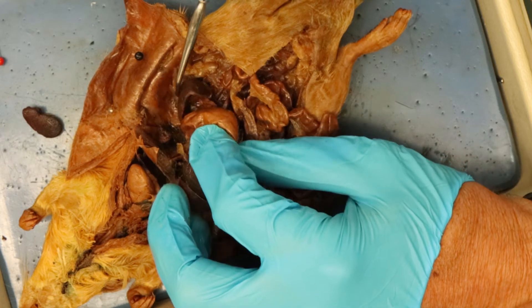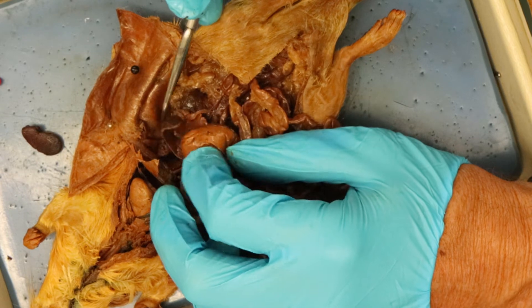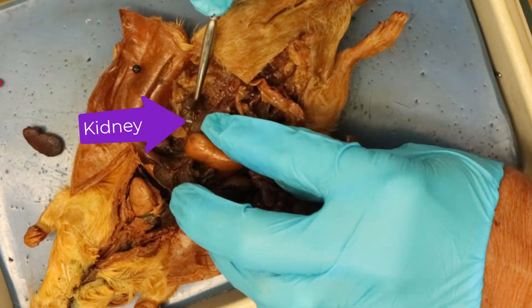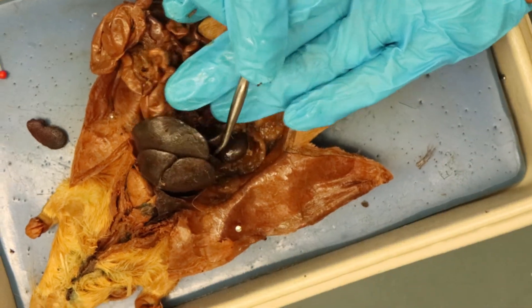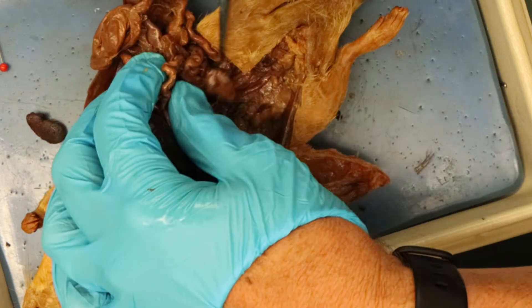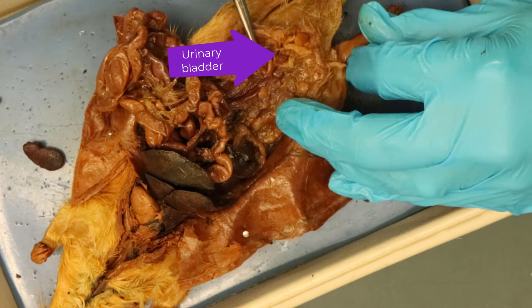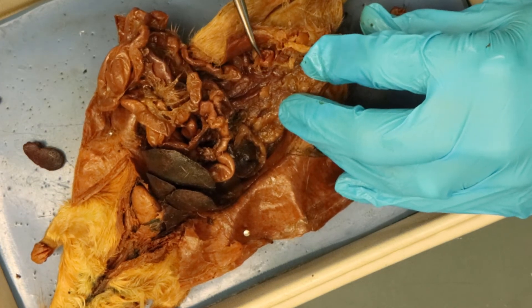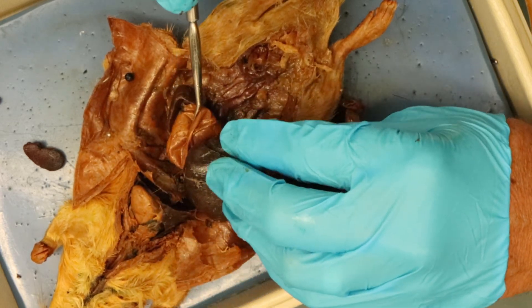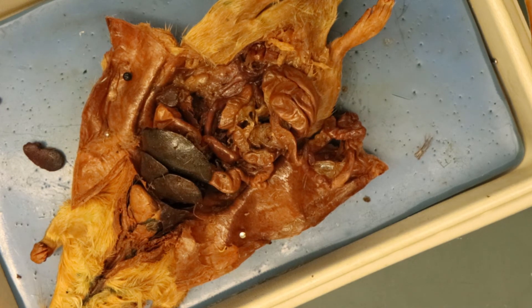If I move over to the left side of the rat I can see the spleen on this side right there. A little bit further back is the kidney — that's one kidney there, and here's the other kidney on this side. Right here you have the urinary bladder on the rat. I think I've covered everything we do on our rat, so that's the rat dissection — there you go.